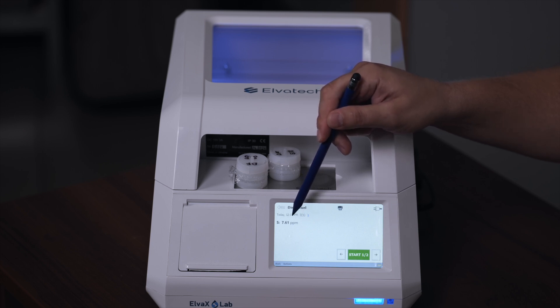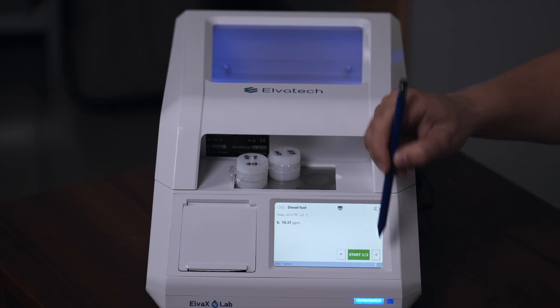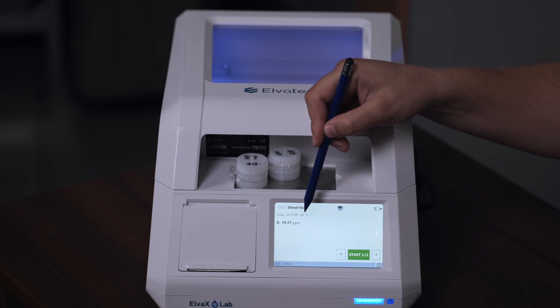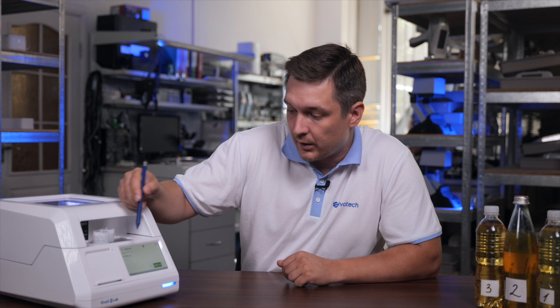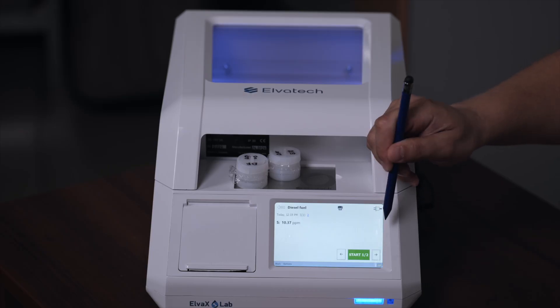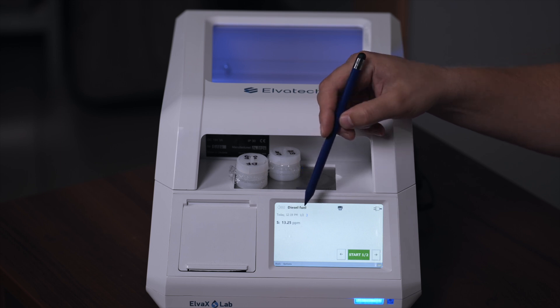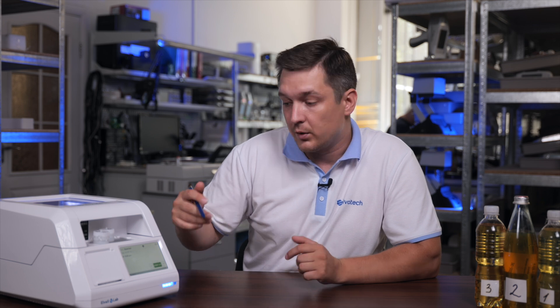The first sample from the first gas station contains 7 parts per million of sulfur content, and we can see that it complies with the international standard. The second sample contains 10 parts per million of sulfur content, which slightly exceeds the international standard. The third sample shows 13 parts per million of sulfur content, which also exceeds the international standard.